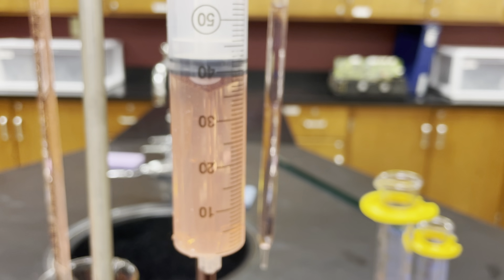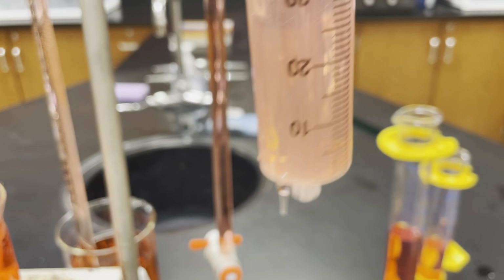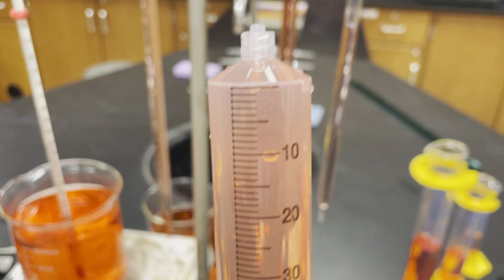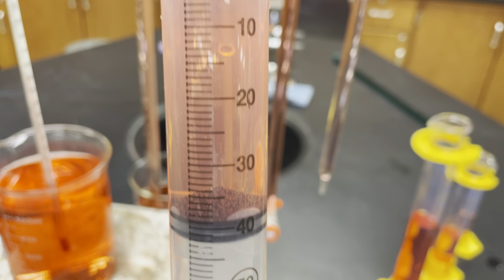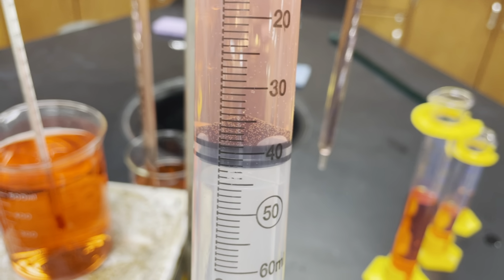All right, so this guy is a syringe. And right now it's upside down, but I'm going to turn it right side up. Now some things it's not totally clear from the beginning where you're making your measurement at. So in a syringe like this, we have kind of a tapered end, and then we're going down 10, 20, 30, 40 in this direction. So it's kind of counting downwards, which is kind of interesting.